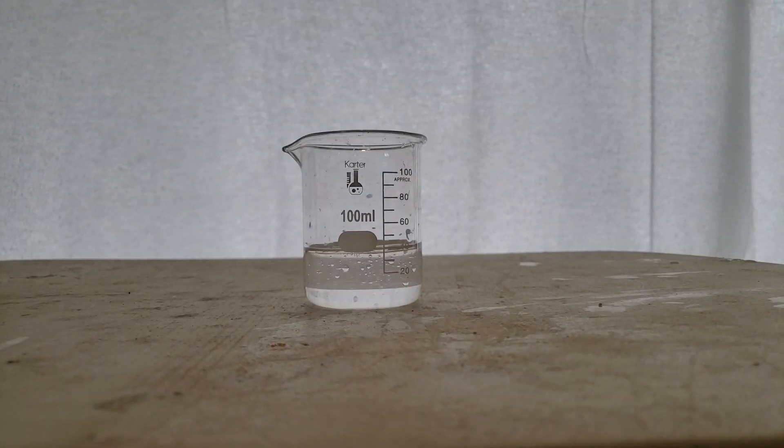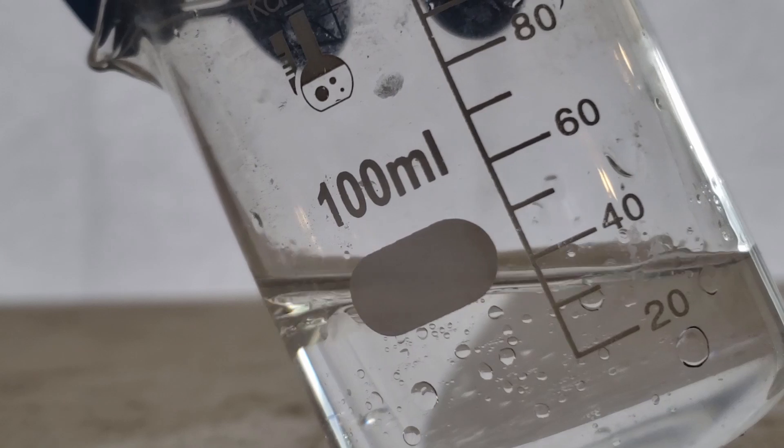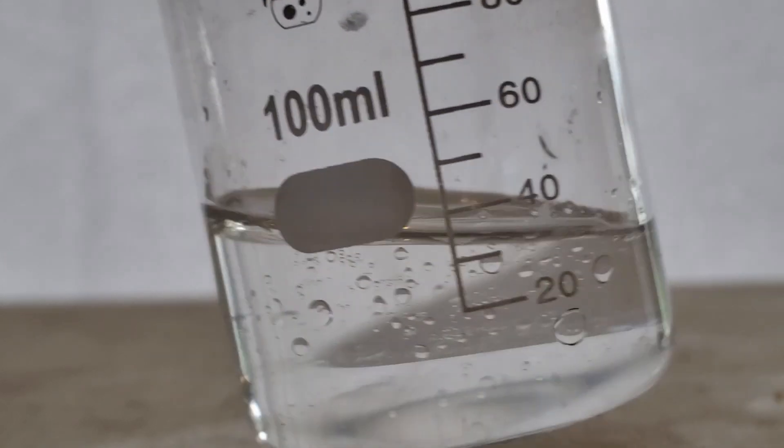After looking at the collection beaker, you can clearly see two separate layers have formed.